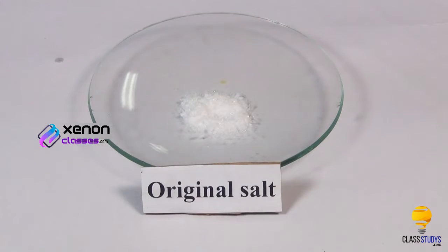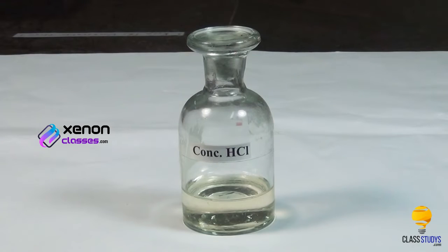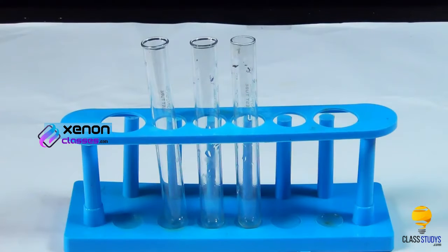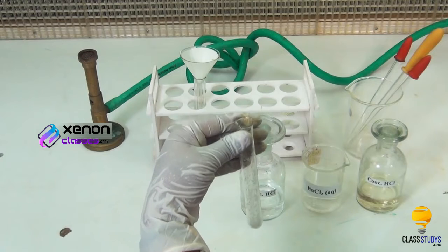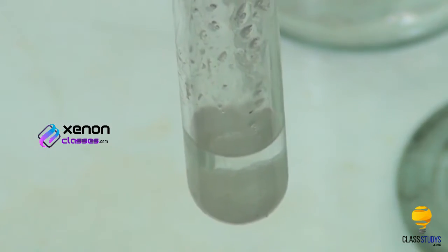Materials required: original salt, dilute hydrochloric acid, barium chloride solution, concentrated hydrochloric acid, droppers, funnel, filter paper, test tubes, test tube holder and Bunsen burner. Procedure: take a small quantity of the salt in the test tube. To this, add a small amount of dilute hydrochloric acid using a dropper.